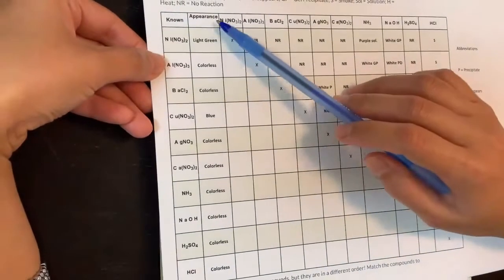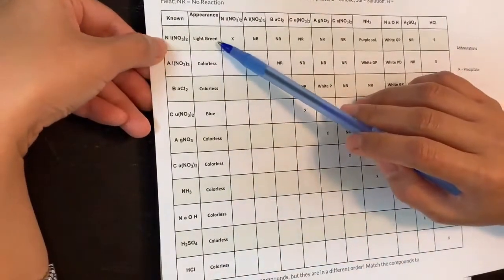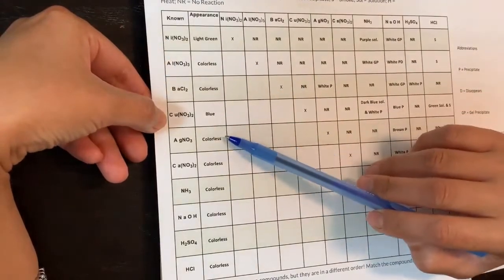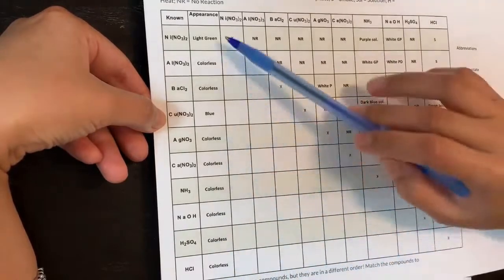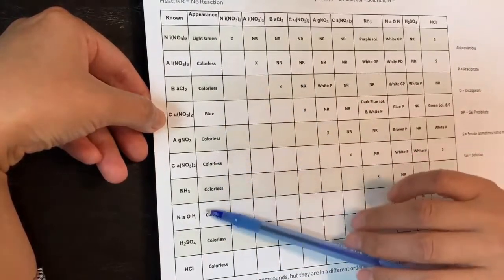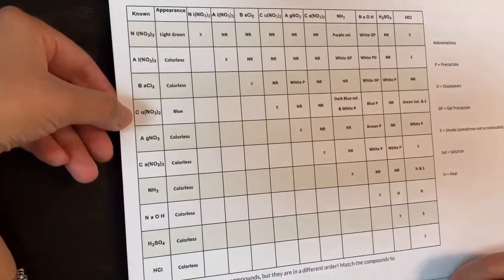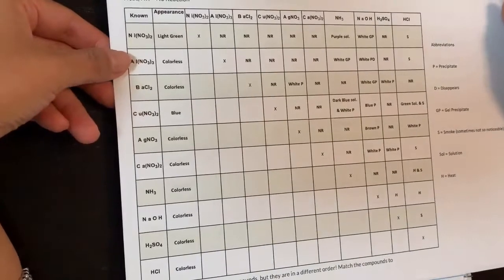There's also a column for appearances. Nickel is light green, copper is blue, and all the others are colorless. Some of them already have color, but the colorless ones will be harder to identify. You can take a look at all the cool observations on the chart.